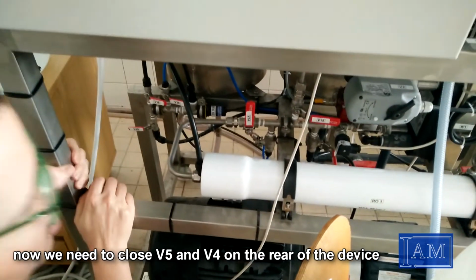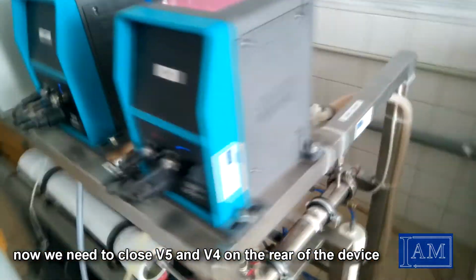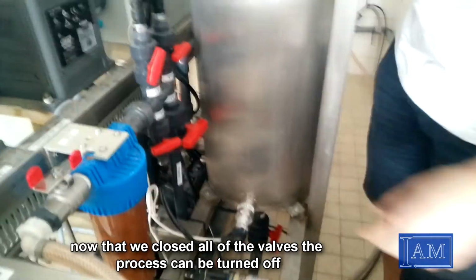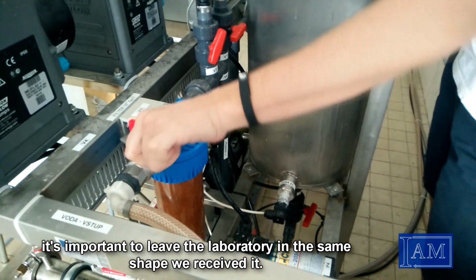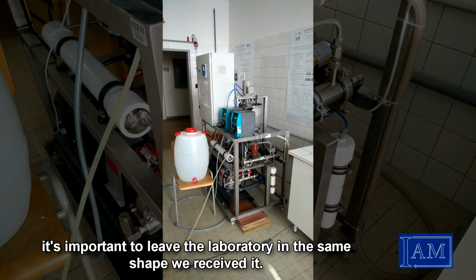Now we need to close V5 and V4 on the rear of the device. Now that we closed all of the valves, the process can be turned off. It's important to leave the laboratory in the same shape we received it.